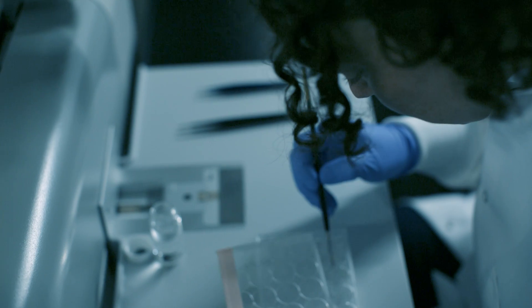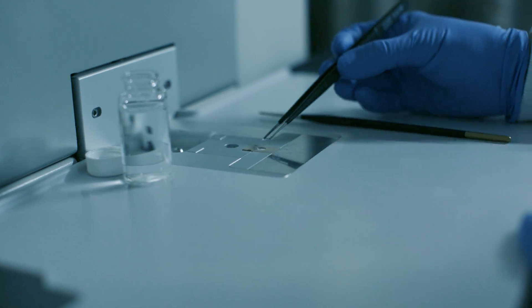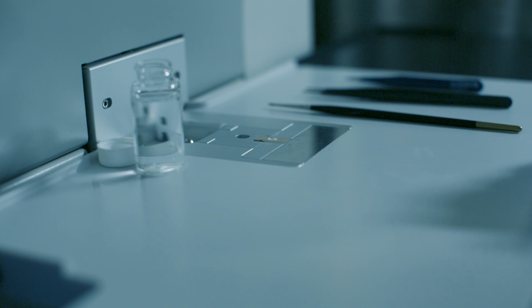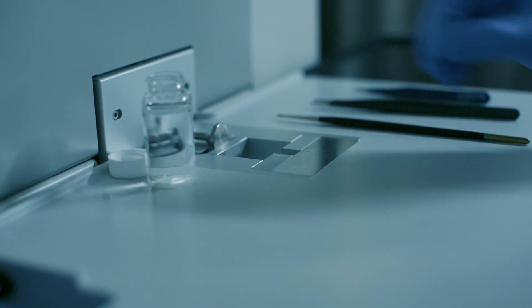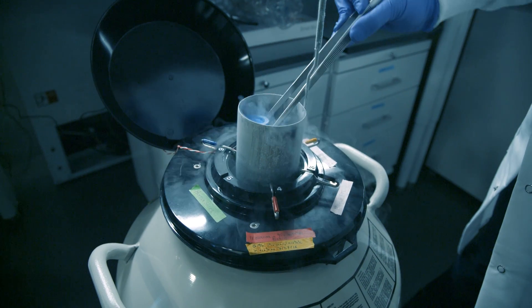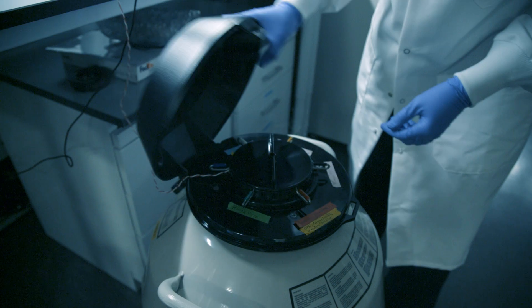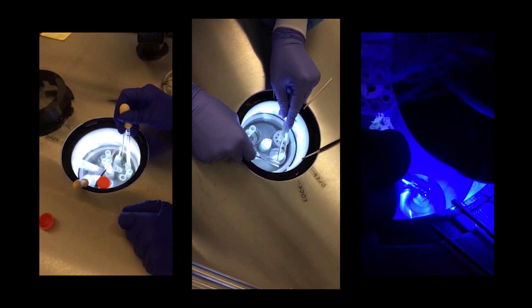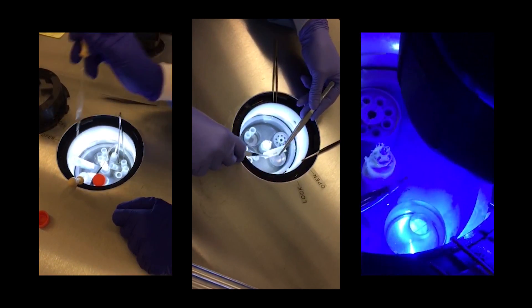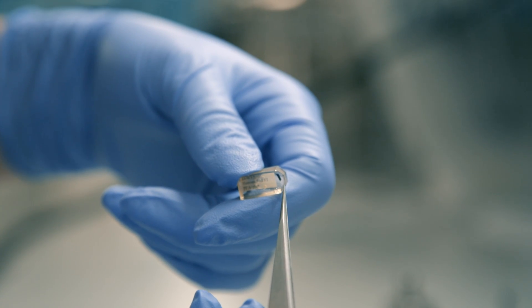We begin with a piece of tissue and we vitrify it — we freeze all of the molecules exactly in place so that we can look at them later. A machine puts about 2,000 atmospheres of pressure on a small sample and instantly immobilizes all of the molecules. The sample then stays in liquid nitrogen at minus 196 degrees, where it's preserved indefinitely. The brain in its living state is mostly water, so the water has to be removed from the tissue and replaced with plastic monomers, embedding the brain in a plastic resin — sort of like an insect in amber.